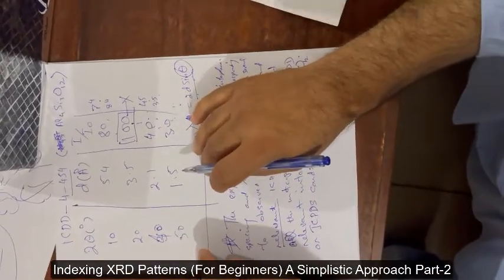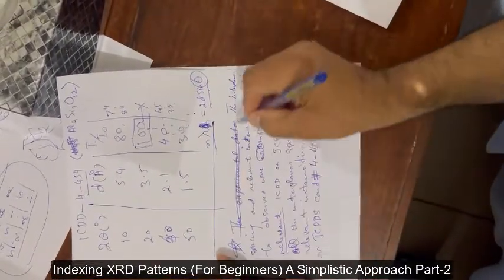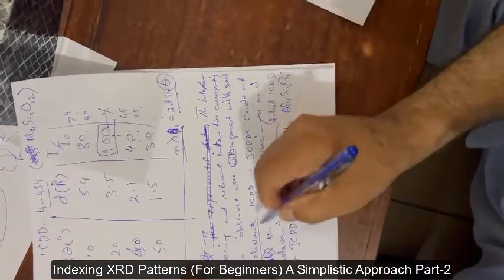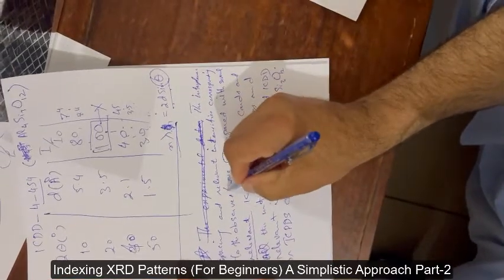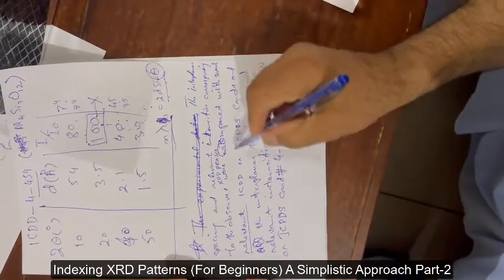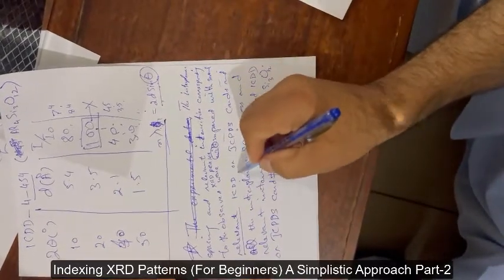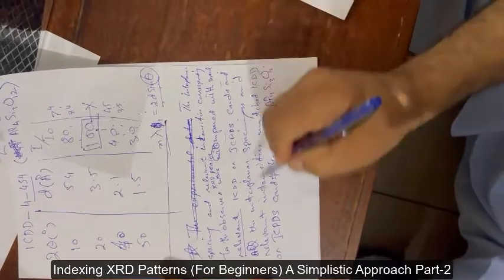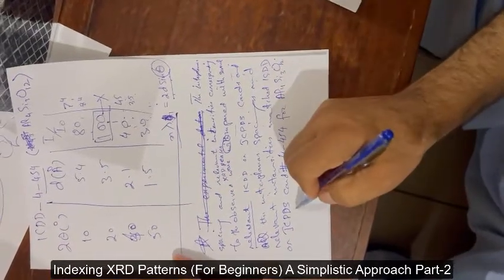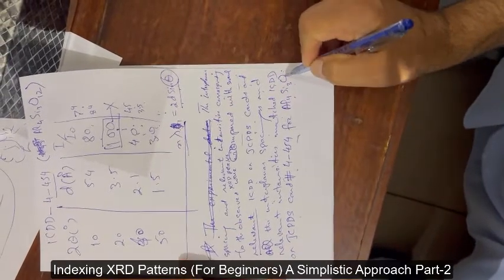You look for the relevant JCPDS or ICDD card and compare it. If they are matching, you don't need to put the experimental data — you just state the interplanar spacings and relevant intensities corresponding to the observed XRD peaks. The observed XRD peaks were compared with several relevant ICDD or JCPDS cards and all the interplanar spacings and relevant intensities matched ICDD/JCPDS card number for Al₄Si₃O₁₂.